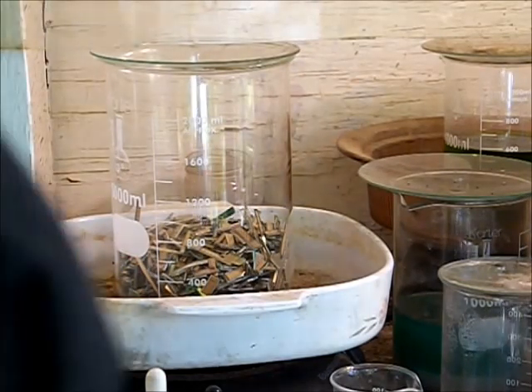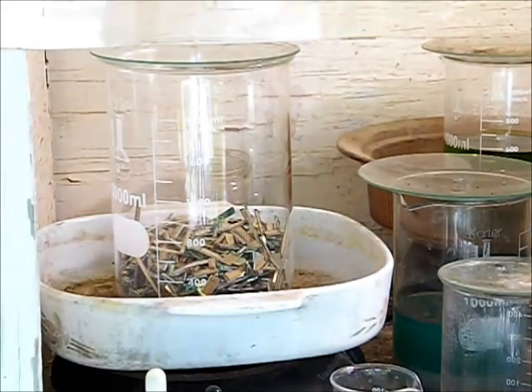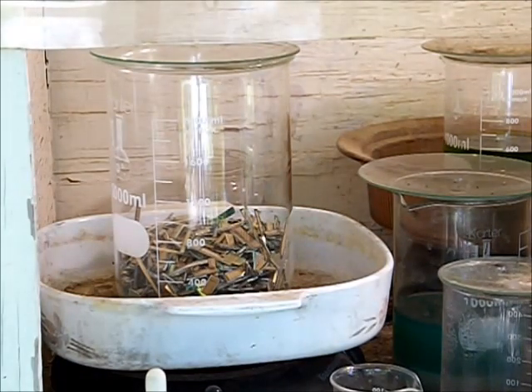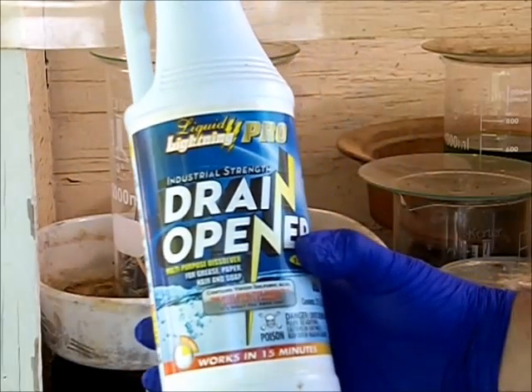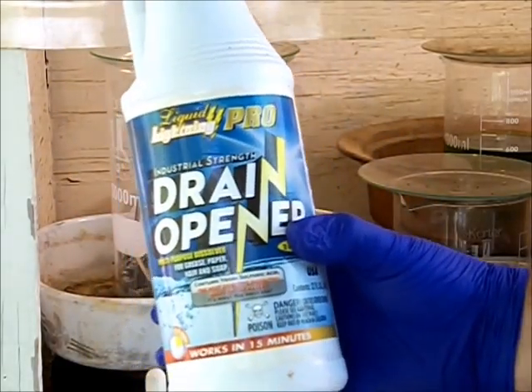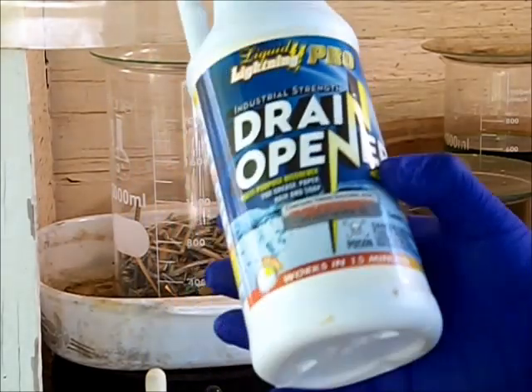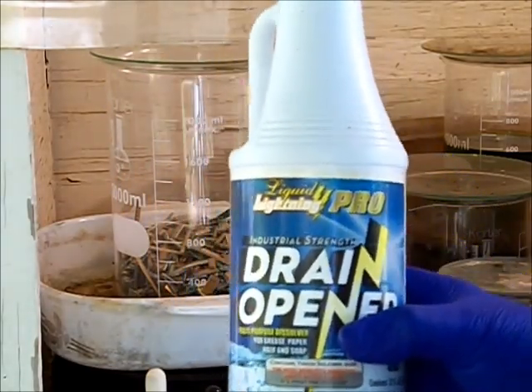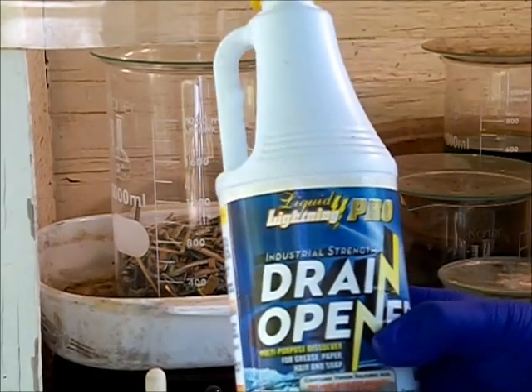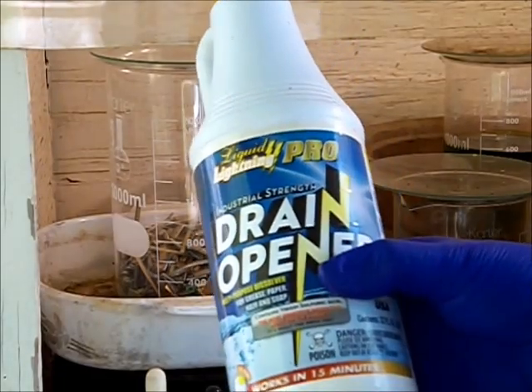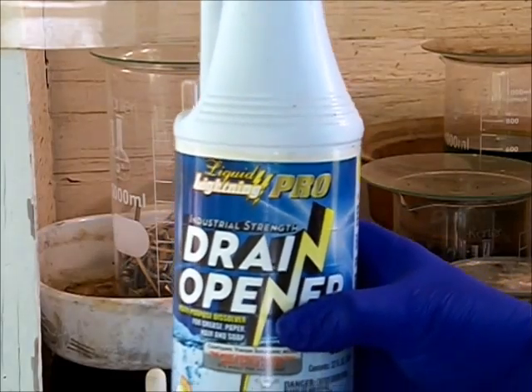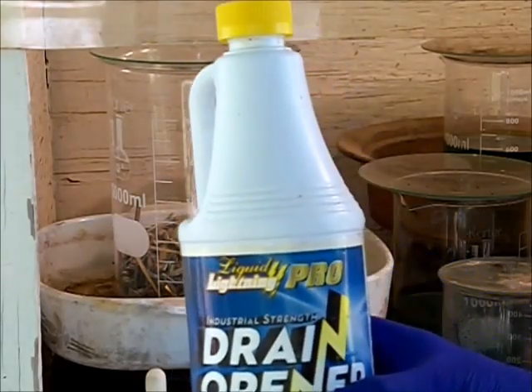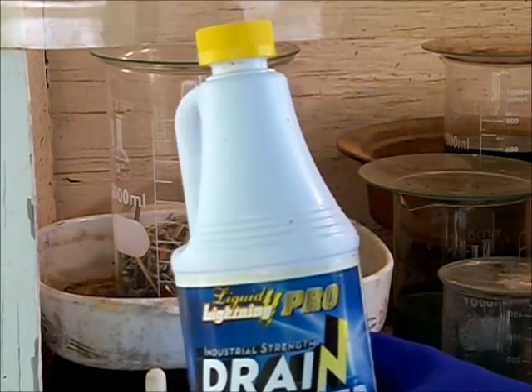My source of sulfuric acid is liquid lightning pro drain opener. This is a very good source of sulfuric acid because it doesn't have any dyes, and from what I can tell it's just 96% concentrated sulfuric acid with no additives, no inhibitors, no dyes, anything like that.